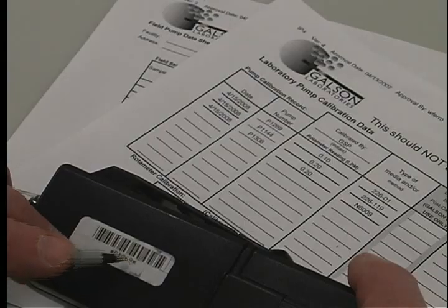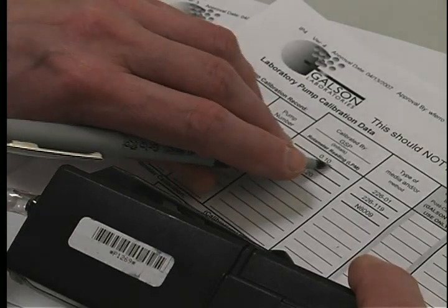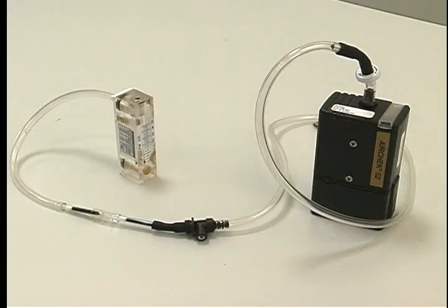All pumps have the lab calibration information on the field pump data sheets provided. Set up the pumps with the correct media in line, with the field rotometer as shown.